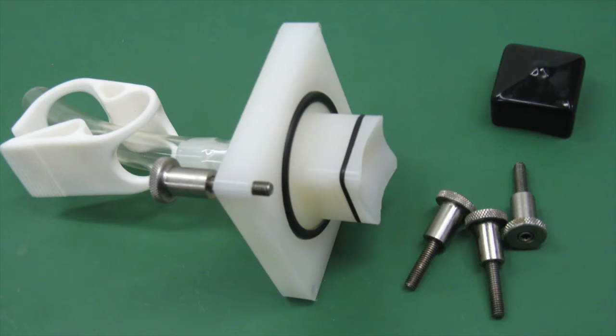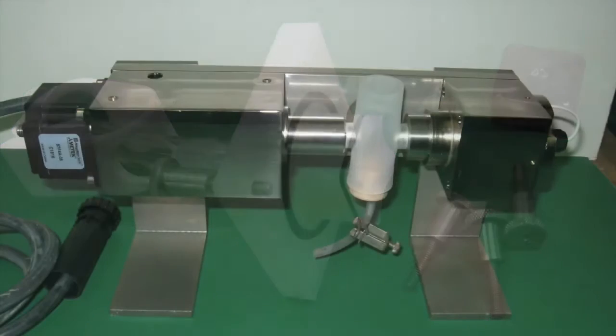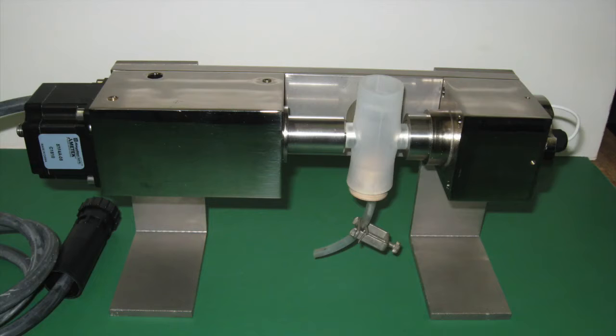The minimum sample chamber decreases sample volume to 20 milliliters for situations when only particle size is to be measured. If sample volume for particle size needs to be minimized even further, below 10 milliliters, we can use this setup. The model which uses this setup for the acoustic sensor is called the DT1210.